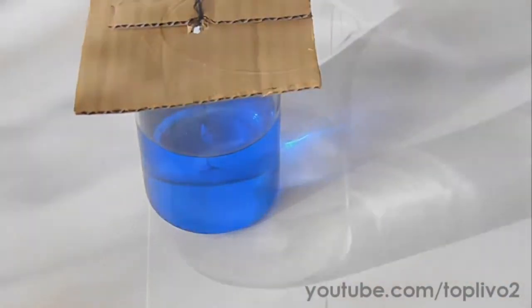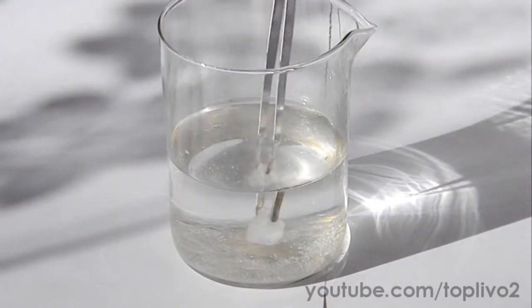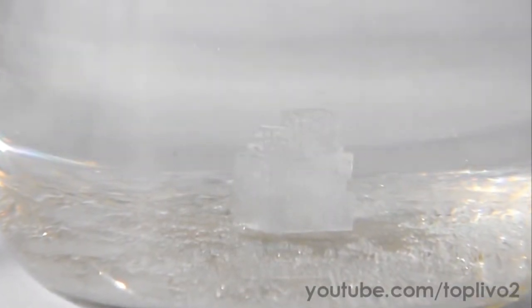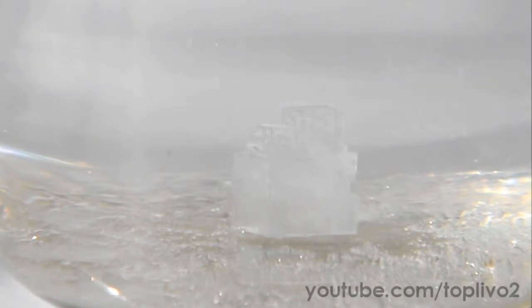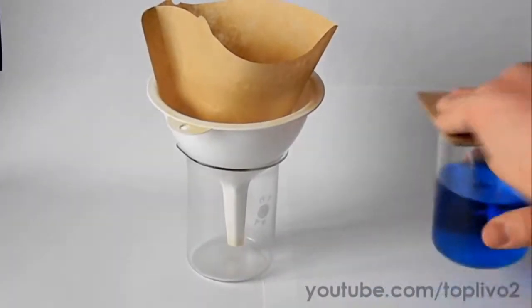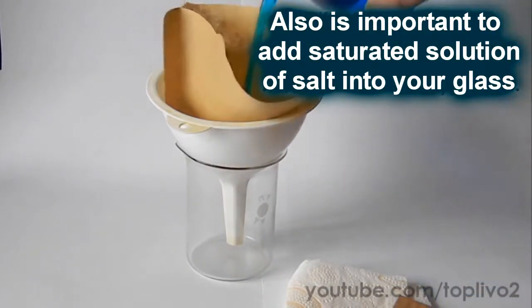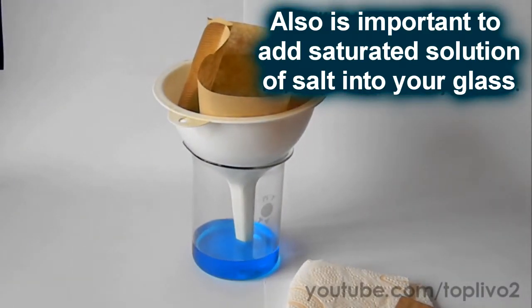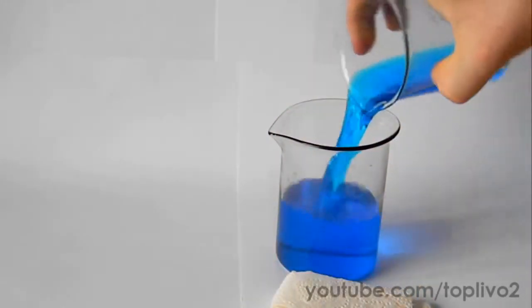When I was doing this before, I was also growing a crystal of a mixture of potassium chloride and sodium chloride, in parallel with making the crystal of copper sulphate. Here it's 60% potassium chloride and the rest is just sodium chloride. If you want to get a very smooth and beautiful single crystal, you'll need to refresh the solution every two weeks to maintain its clearness. If the solution is dirty, a crude crystal will grow and you'll get a polycrystal instead of the single crystal we want.